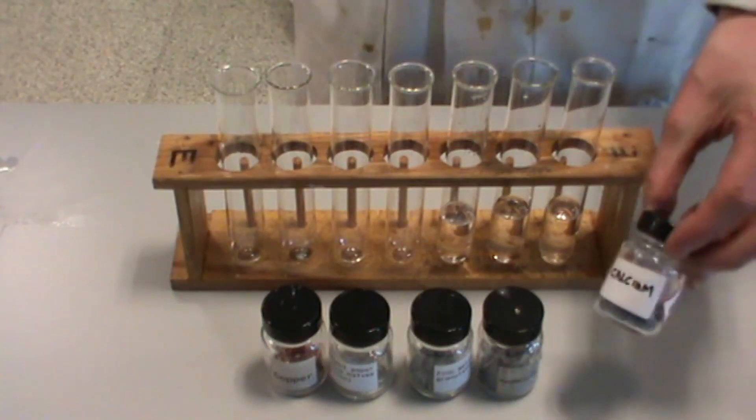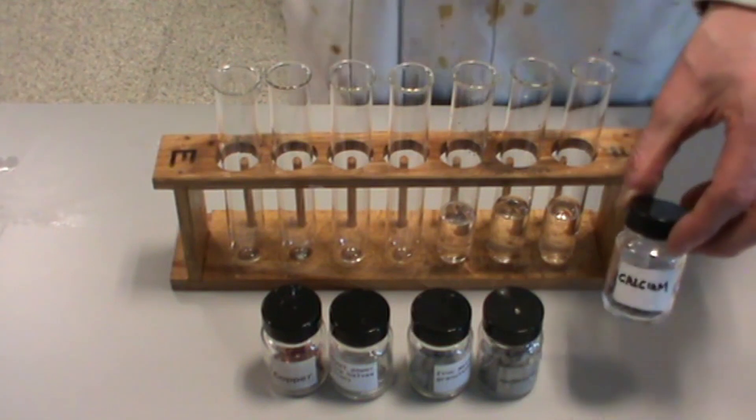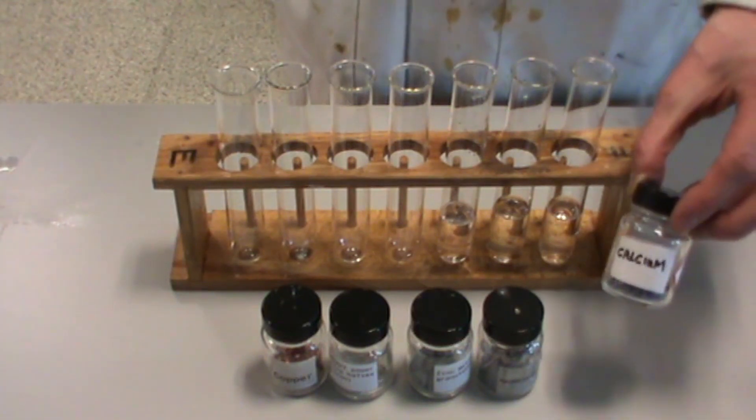Calcium is one of the more reactive metals that we are allowed to use in laboratories. Here is its reaction with water.